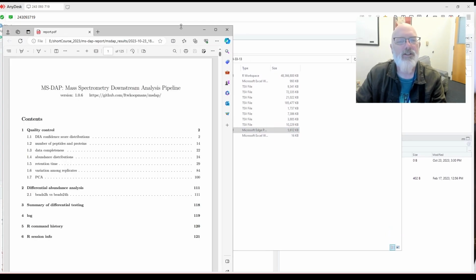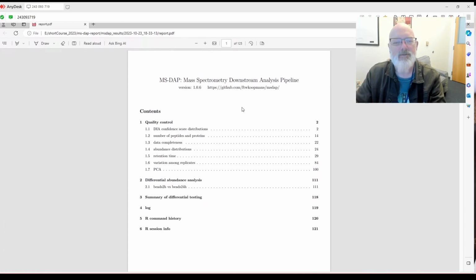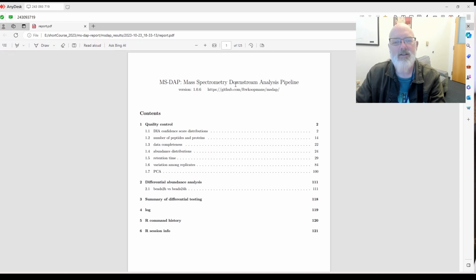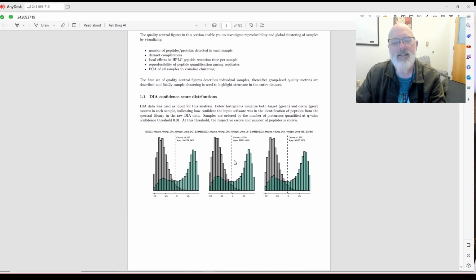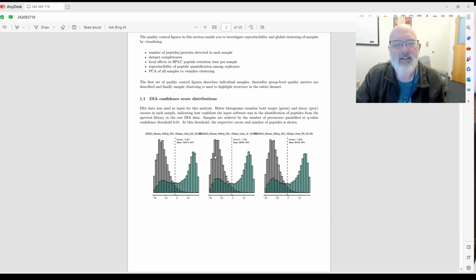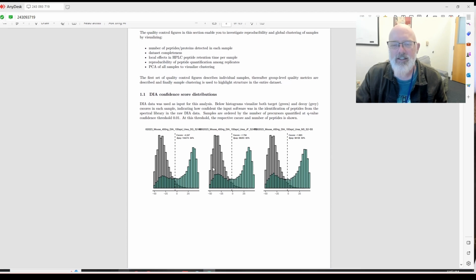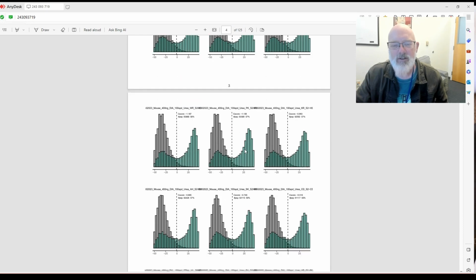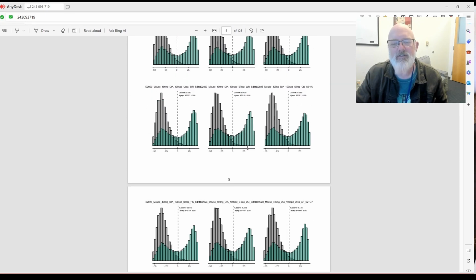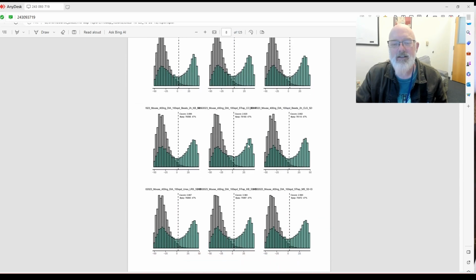So yours should take significantly less. So remember, I had over 100 different samples here. All right, so it gives you a nice report, gives you some quality control graphs. These are actually really nice. The C-score for Spectronaut with the normal and reverse decoy sequences, and you can see the distribution. So what you want to look for is things that look out of place or different. And we had at least a few files here that didn't work very well.